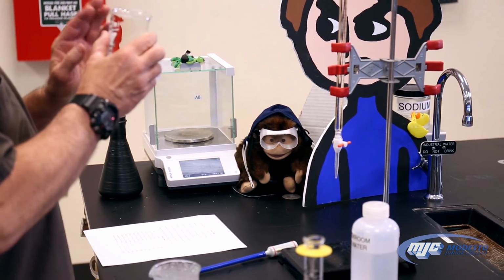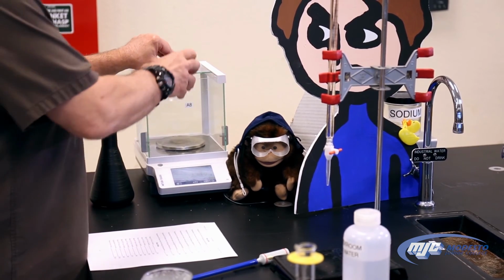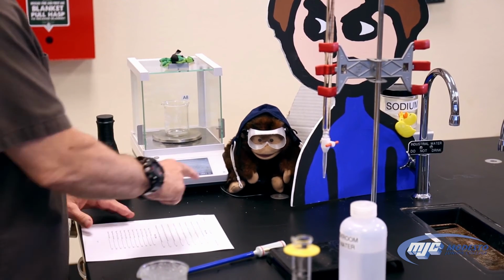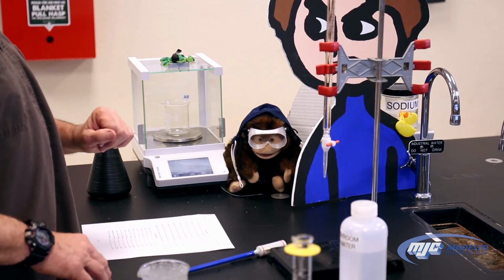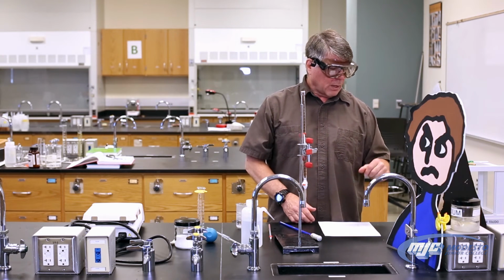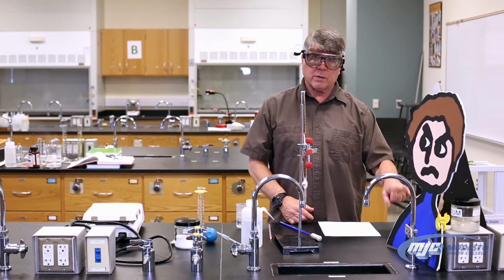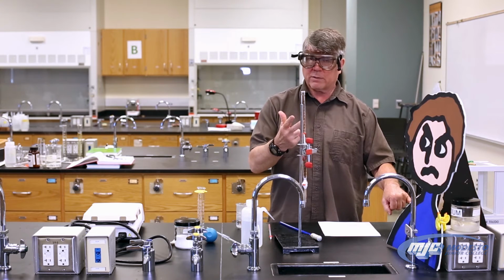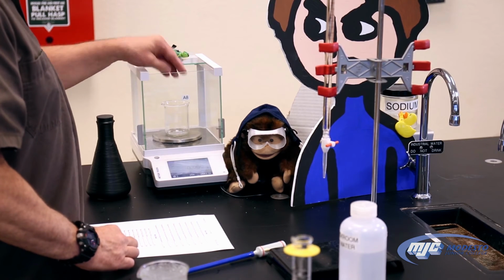we don't care how much the beaker weighs, so we're going to use the tare function on the balance. To do that, place the empty beaker on the balance, close all the doors, and press the button on the front, and it should read 0 all the way across with the empty beaker on there. So it's subtracting the mass of the beaker for us. Digital, so that means we record every digit that's there. These balances are 3 places past the decimal, to the right of the decimal, and the units are little g for grams. So we take this out.